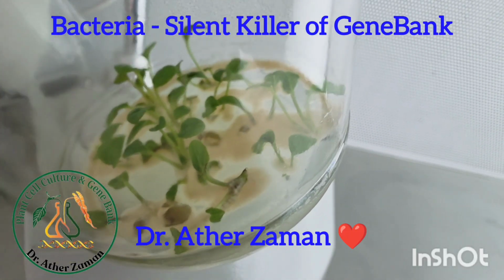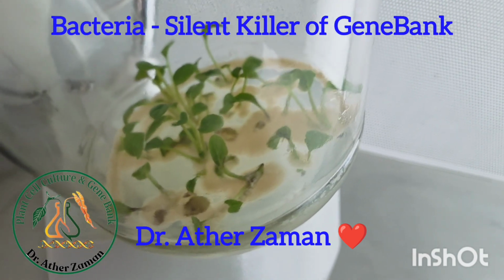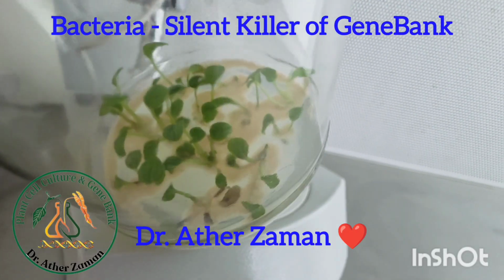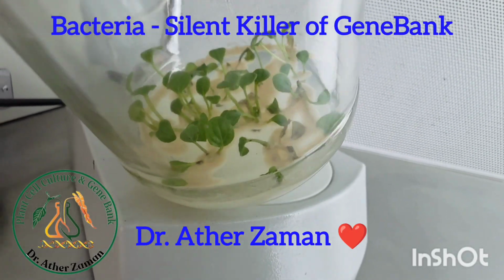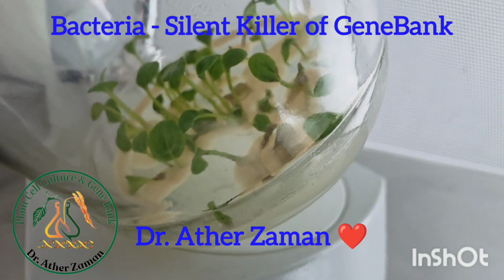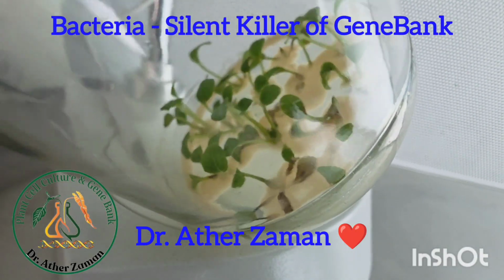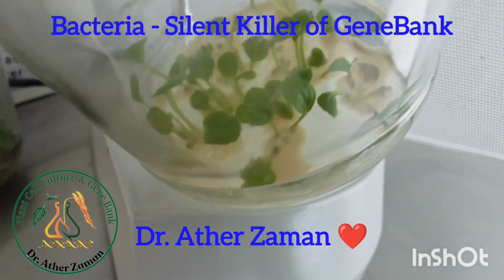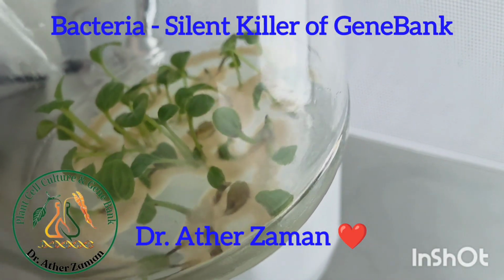Of as many as 15 small plants, if you go through the rescue culture, you might get hardly 2 or 3 plants maximum. The others will die because these plants are very small and they will not be able to resist the early effect of the sterilization procedure. So that is very vital.